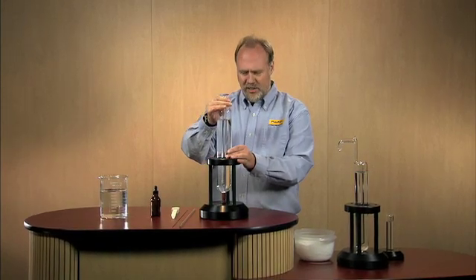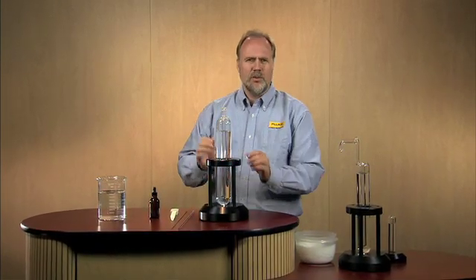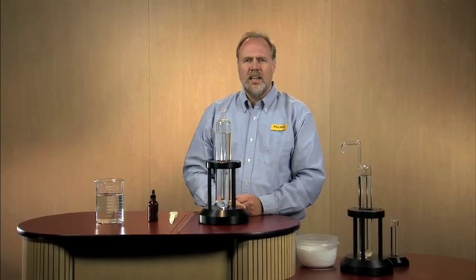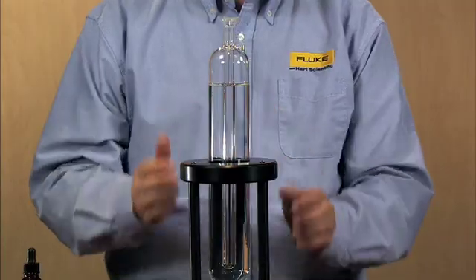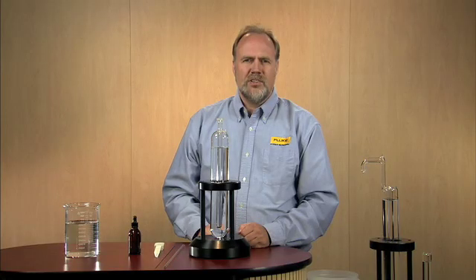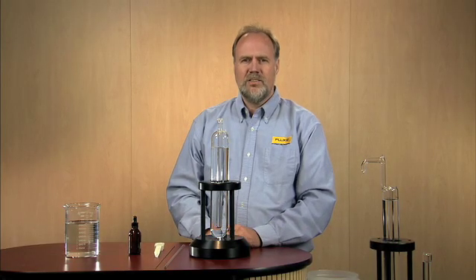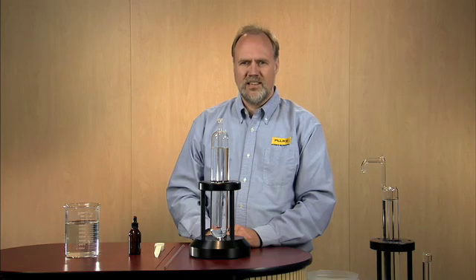Triple point of water cells are used in labs throughout the world to calibrate and maintain precision thermometers. When properly prepared, this cell will provide a reference temperature for you of exactly 0.010 degrees Celsius.